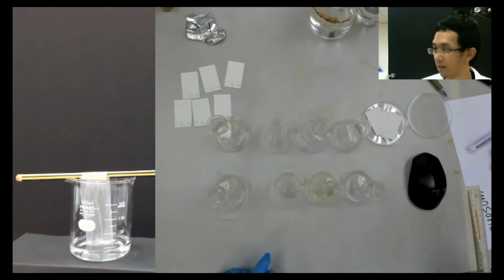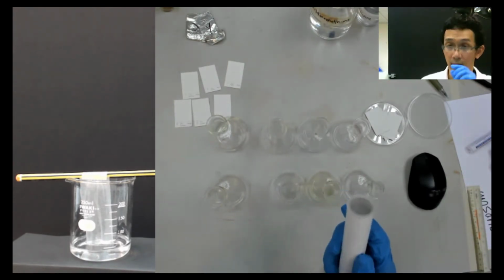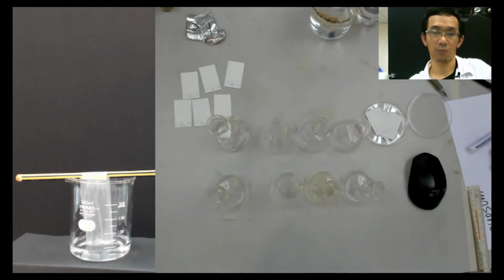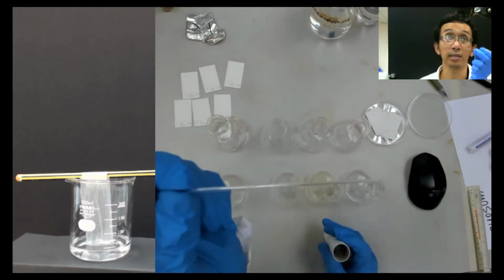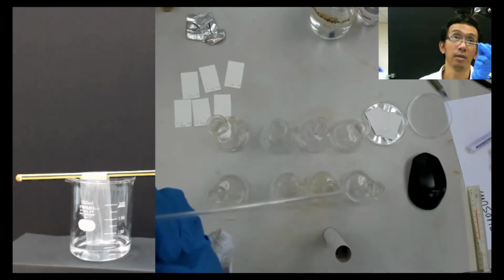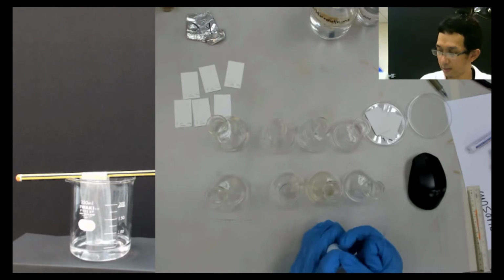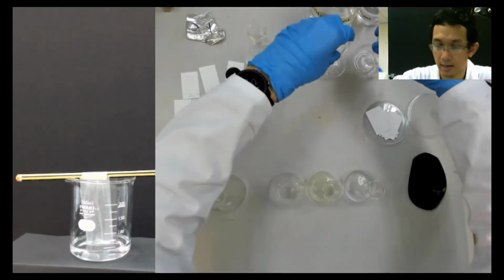So we do that using this, the same thing as what we call our melting point, but we need to adjust a little bit because we do not need it this big. This is still big. If you see, this is still big. We want just a small drop only. So we need to adjust this thing. So how to do that is basically, I put here, I put here, I put here.